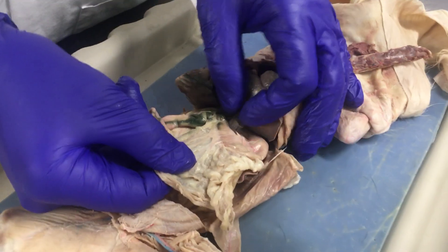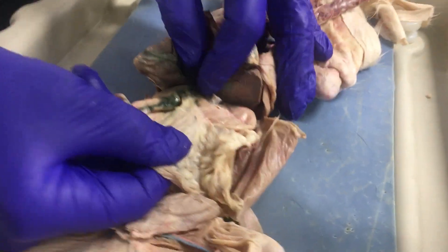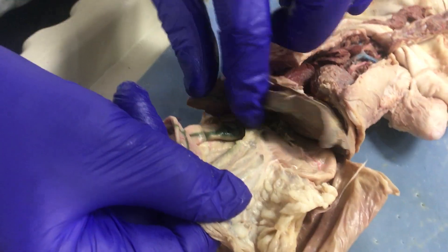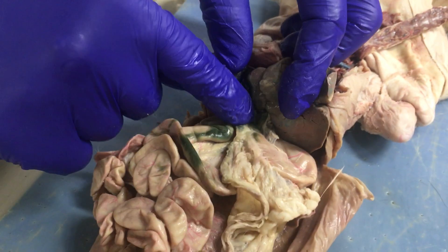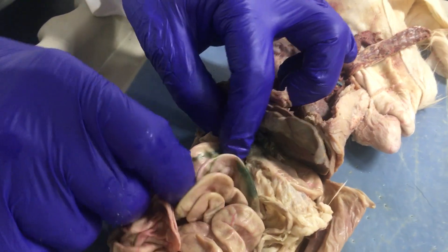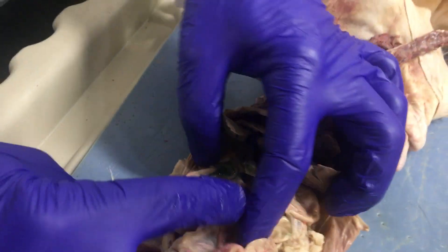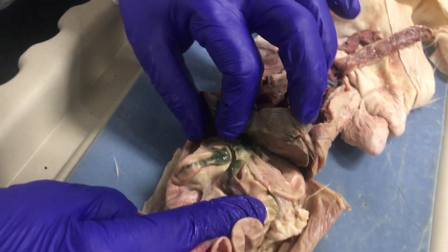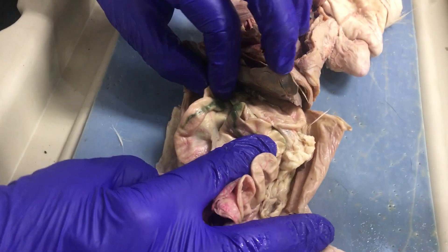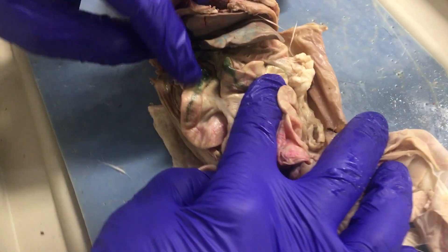So we left off over here at the stomach. The stomach enters from the pyloric sphincter into the small intestine, and the first segment is the duodenum.